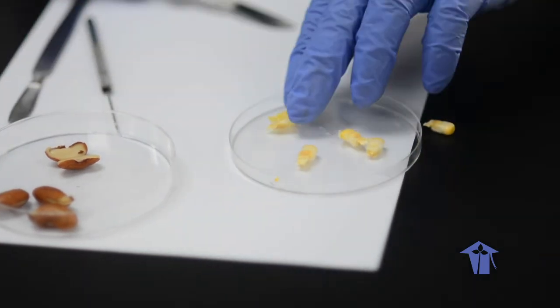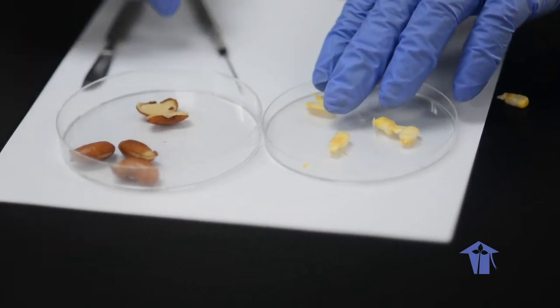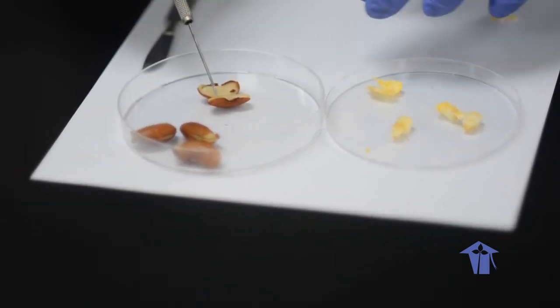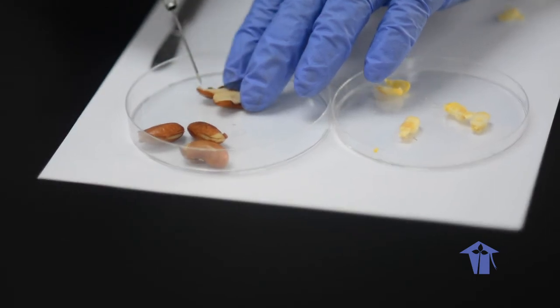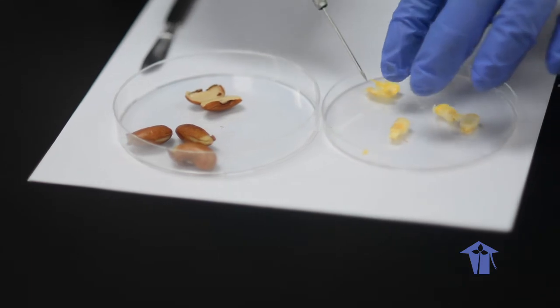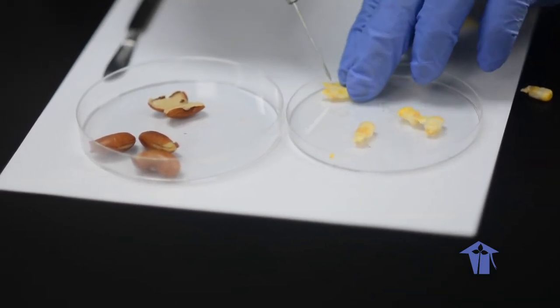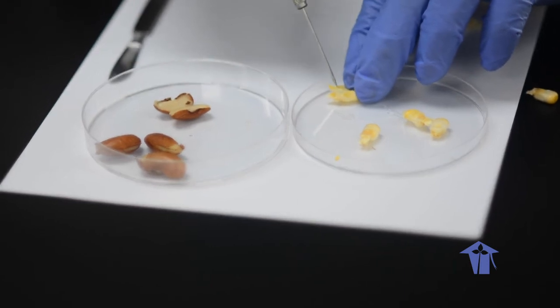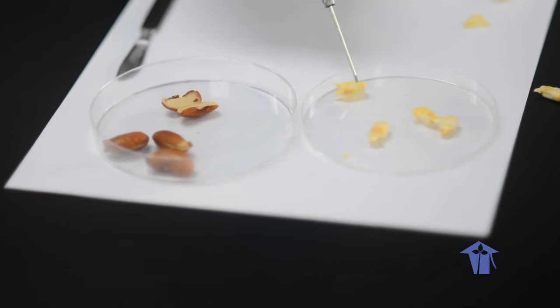And so your corn, notice the difference between your corn and your red bean, right? So for a red bean, the embryo was along here, right? So a bit of it got cut. The embryo is along here: epicotyl, hypocotyl, radicle. And the embryo in this one, let's look, it seems to be on this side. The embryo is here, and the endosperm is here, right?